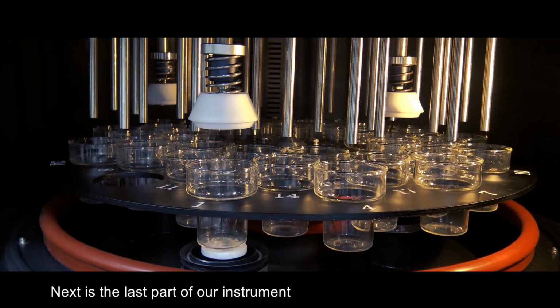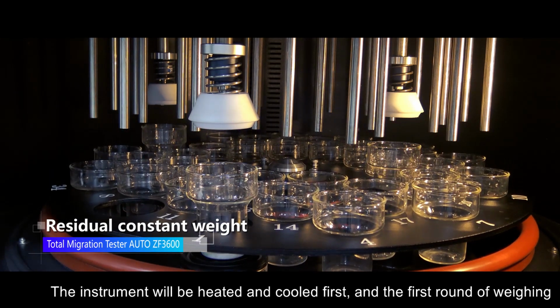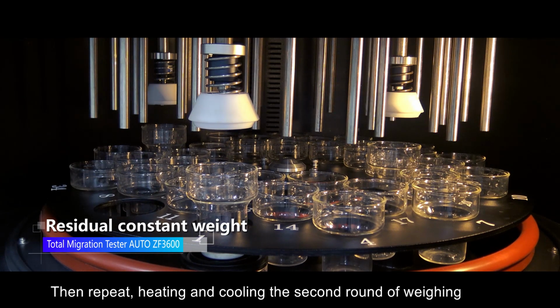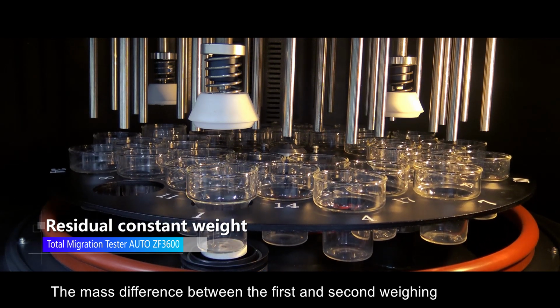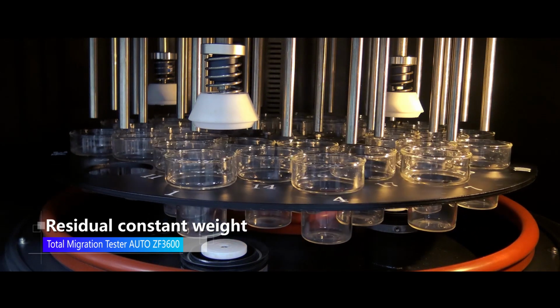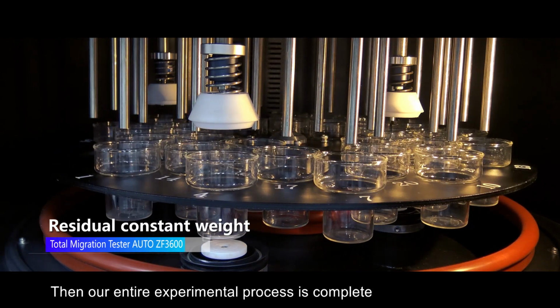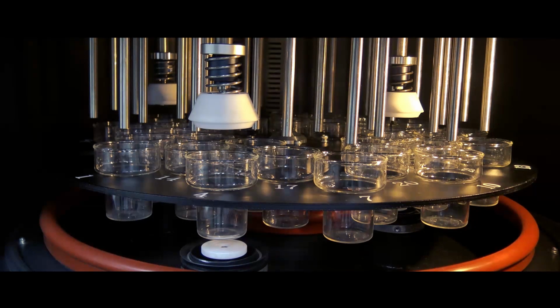Next is the last part of our instrument, the residue constant weight. The instrument will heat and cool first, then do the first round of weighing. Then it repeats heating and cooling for the second round of weighing. The mass difference between the first and second weighing should be below the set 0.3 milligrams. Then our entire experimental process is complete. Test terminated, end.